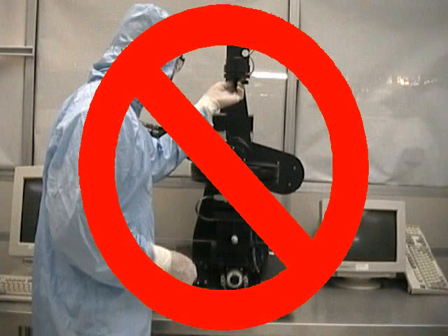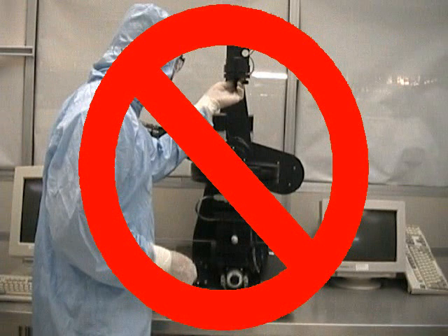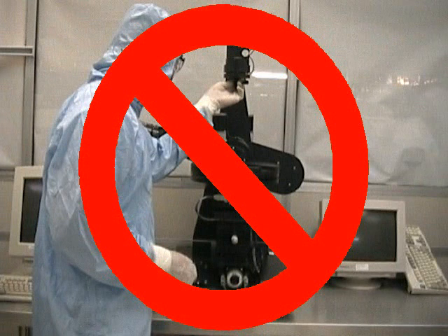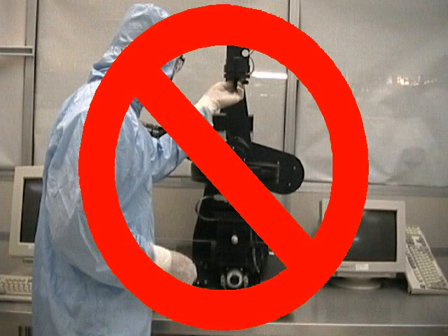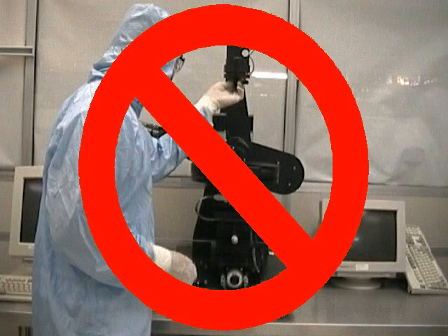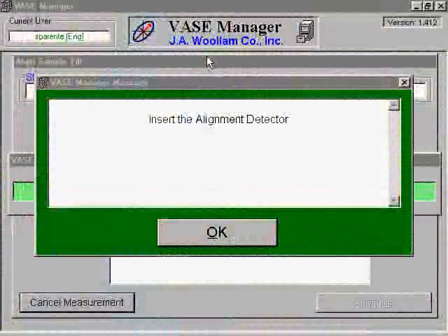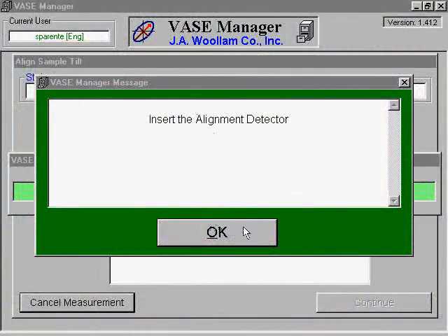It is very important to use extreme caution when inserting the alignment detector. Breaking or even bending the pins will render the detector useless and will require its replacement. Inserting the detector can be very tricky and may take you several tries. Once the detector is in place, click OK.